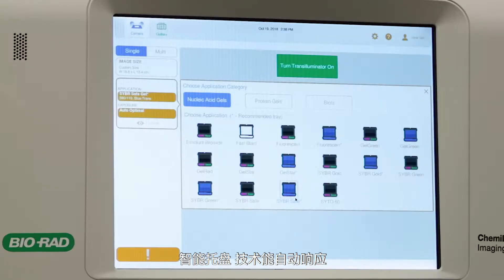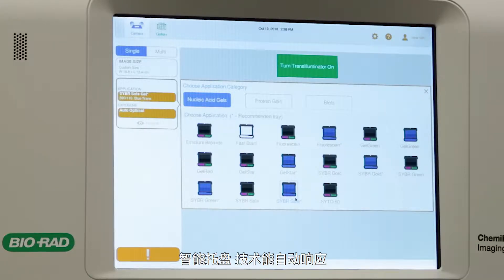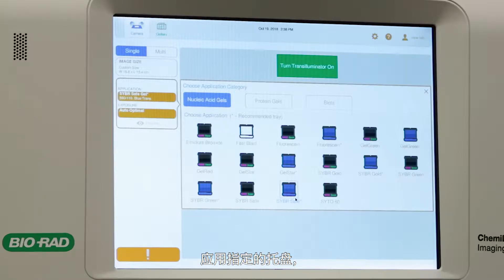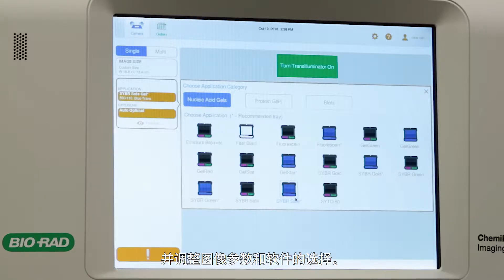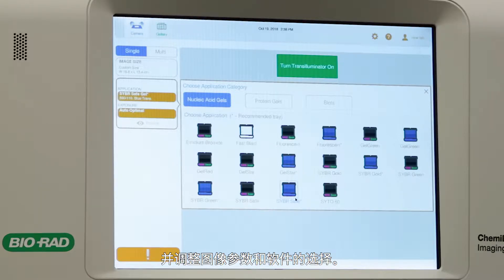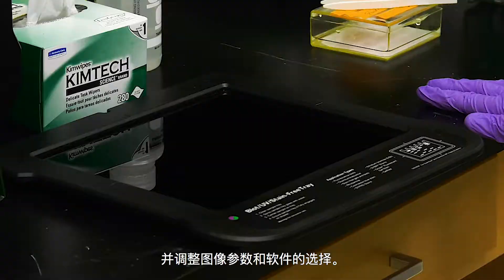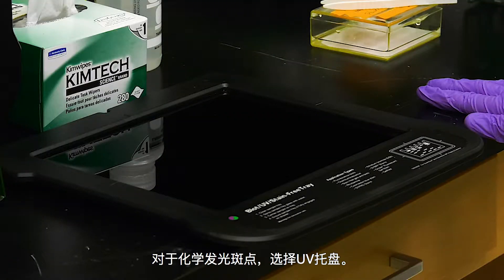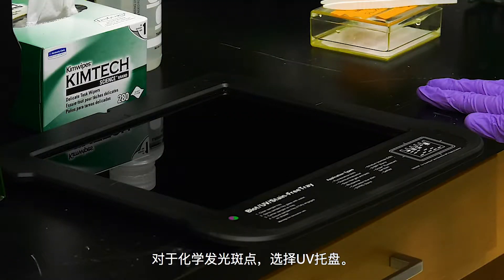SmartTray technology automatically responds to the application-specific trays and adjusts imaging parameters and software options. For chemiluminescent blots, select the UV tray.